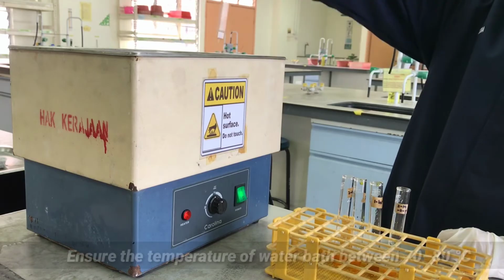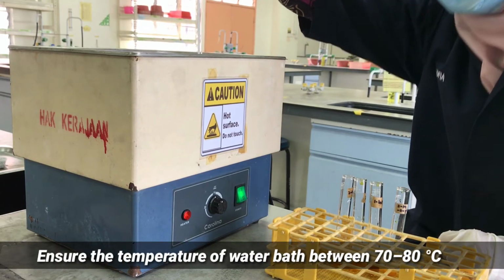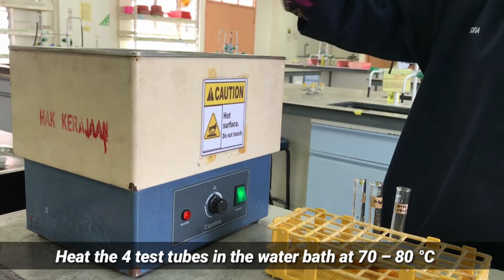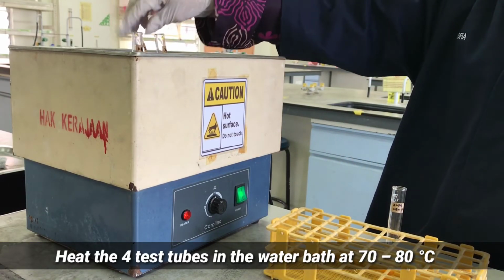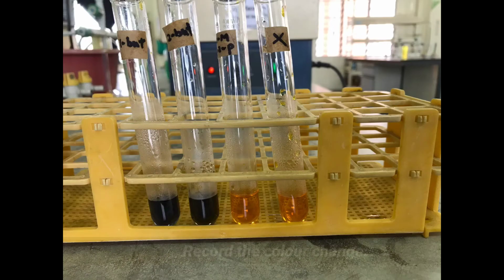Ensure that the temperature of the water bath is between 70 to 80 degrees Celsius and heat the 4 test tubes. Record the color change and tabulate the observations.